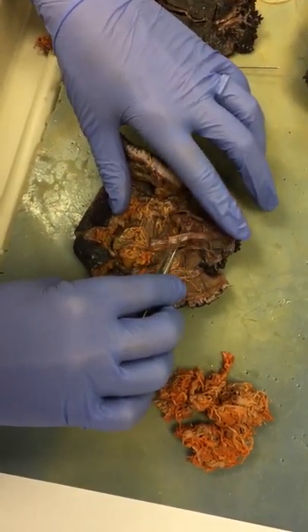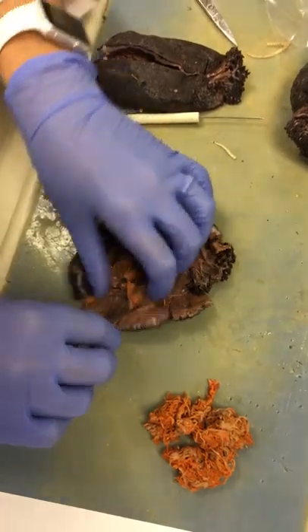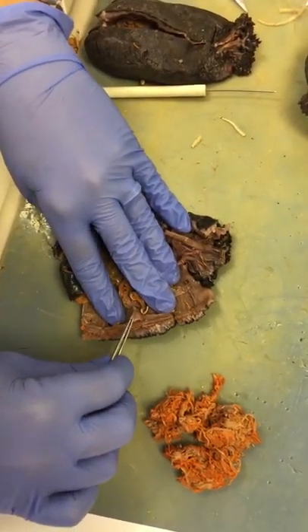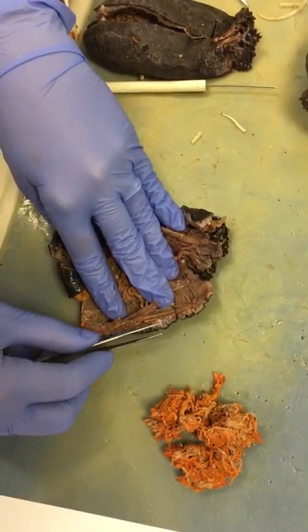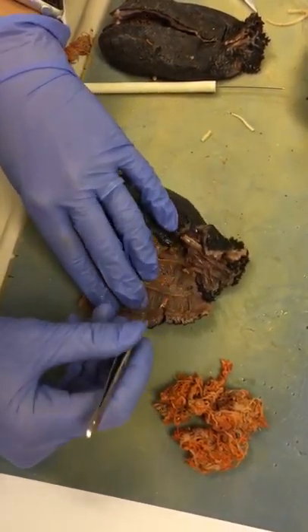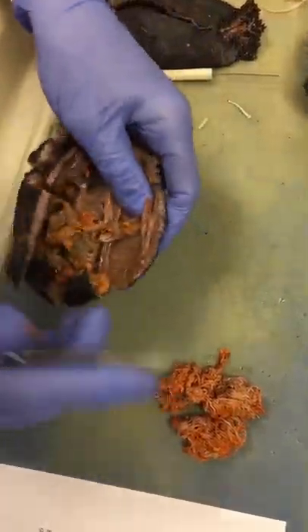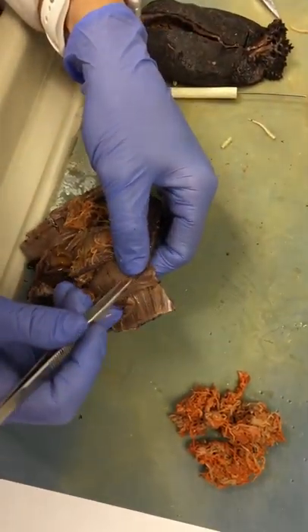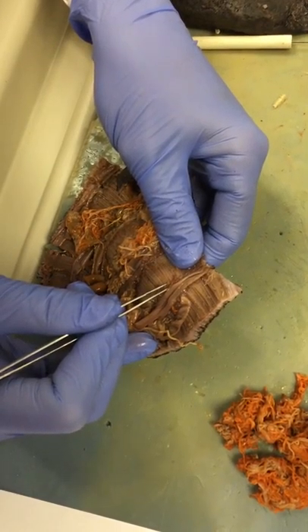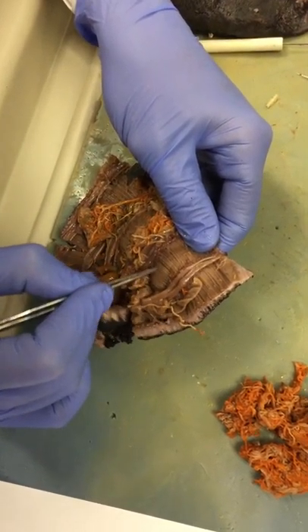They'll relax when they're feeding so they'll get longer. The retractor muscle is actually attached to the base here. It has been cut, and this is a longitudinal muscle, and you can see the body wall also in this area. Next to the longitudinal muscle, you can see these little dots — the ampullae — which are attached to the tube feet. That makes this area the ambulacra and this area the interambulacra.